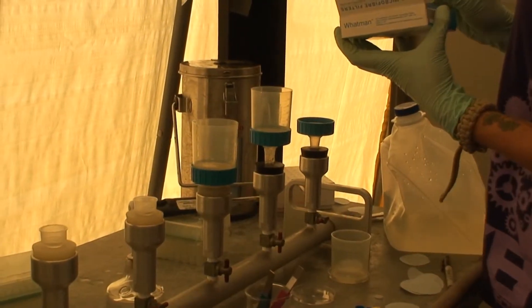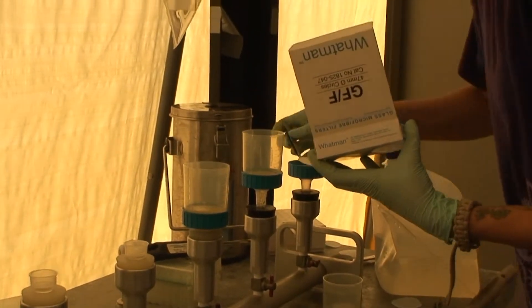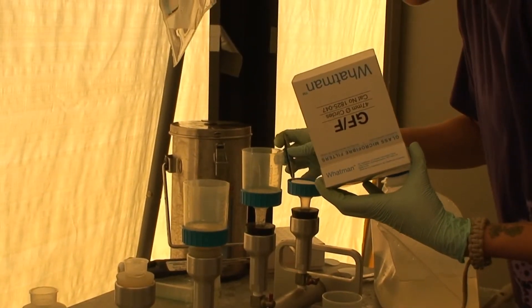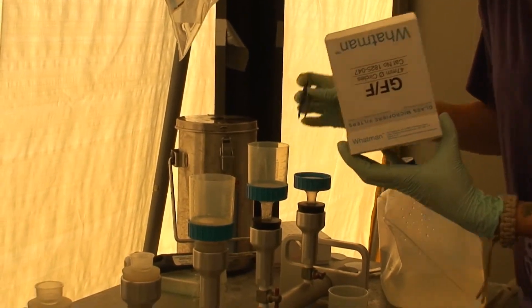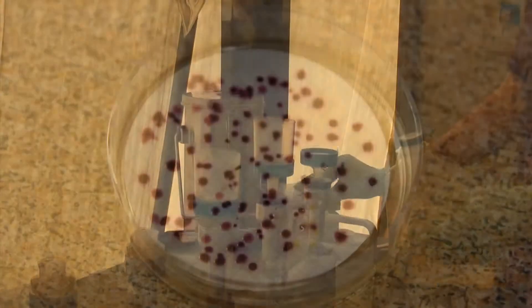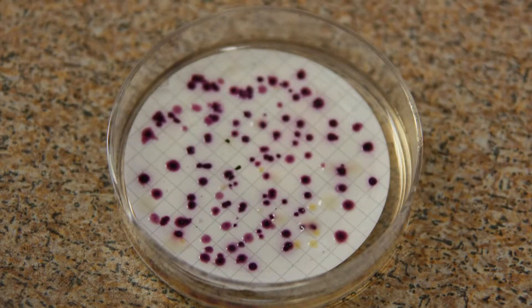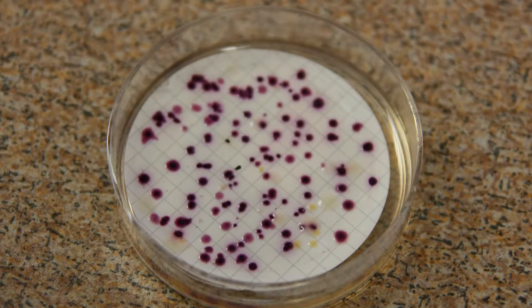In contrast, the membrane filtration method catches the bacteria on a small filter. The filter is then put on growth media overnight, and you count how many colonies have grown.